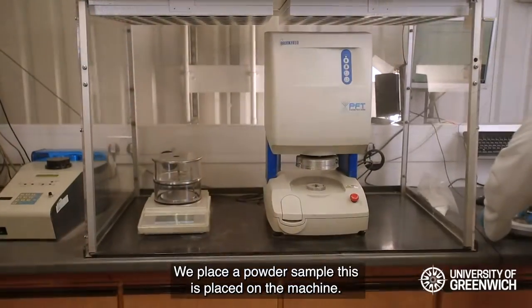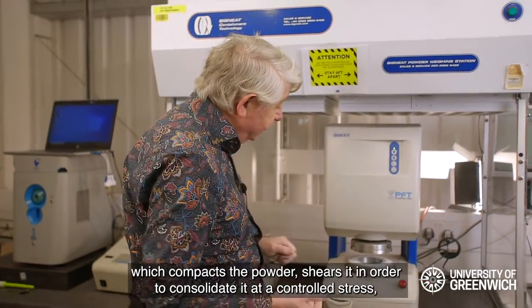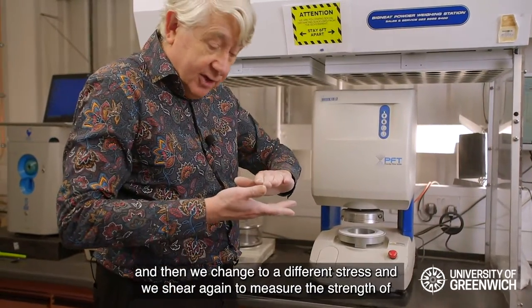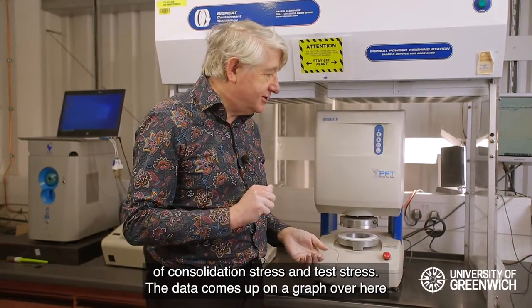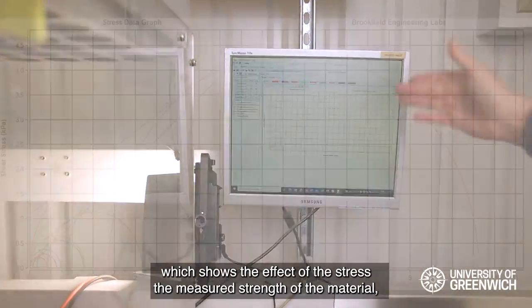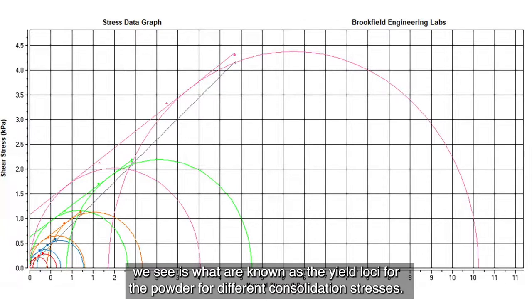We place a powder sample in the test cell and place it on the machine. With that done, we start a test under computer control, which compacts the powder and shears it to consolidate it at a controlled stress. We then change to a different stress and shear again to measure the strength of the powder. Under automatic control, this runs about 40 different tests at different values of consolidation stress and test stress, and the data comes up on a graph showing the measured strength of the material versus the test stress.